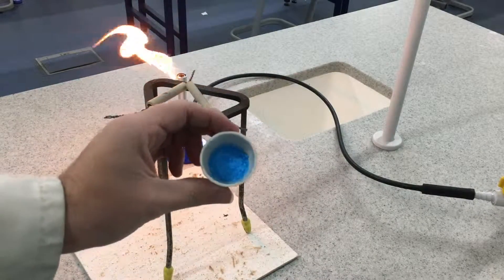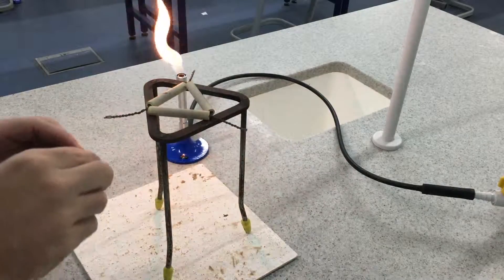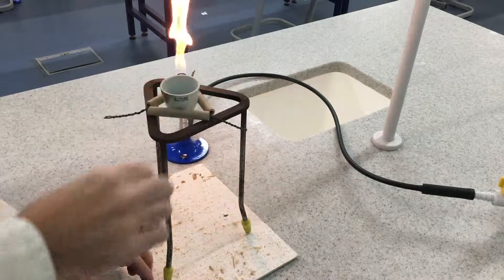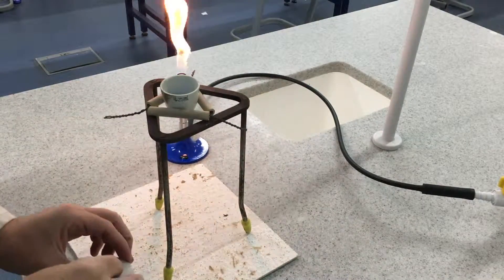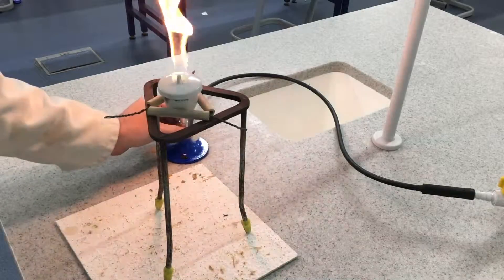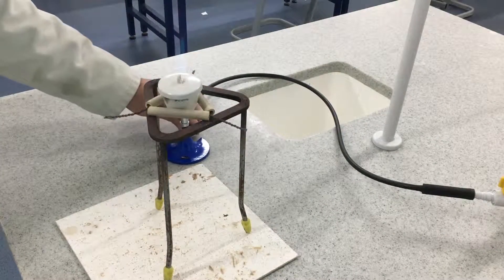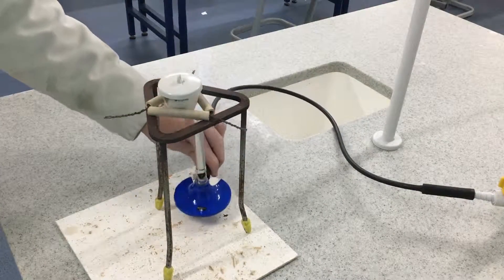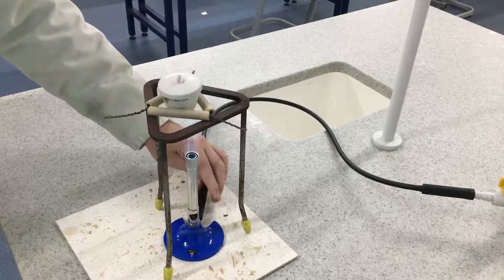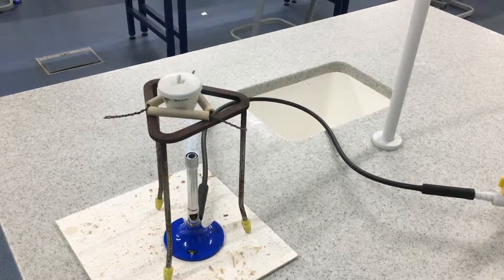So now we have our pre-weighed copper sulphate in the crucible. Put the crucible on a clay pipe triangle, add the lid and we heat it until such time as all of the blue hydrated copper sulphate turns into white anhydrous copper sulphate.